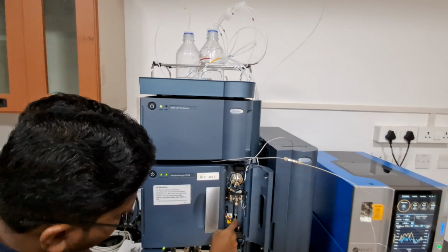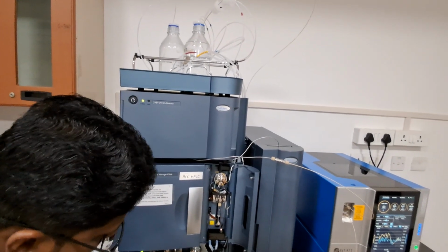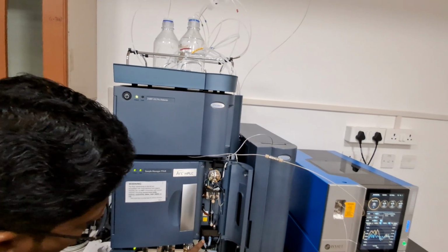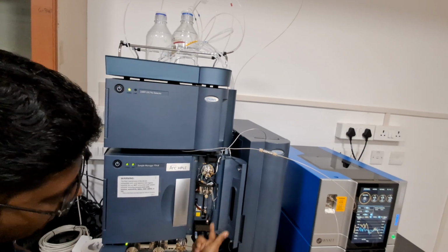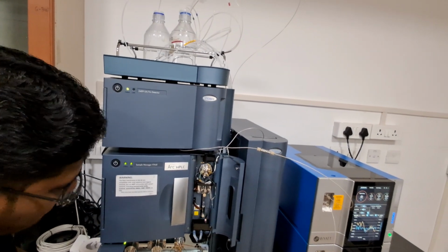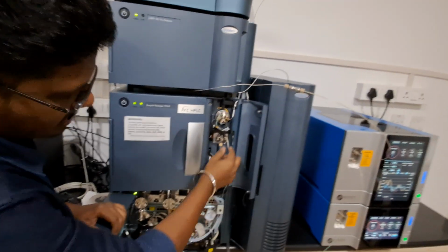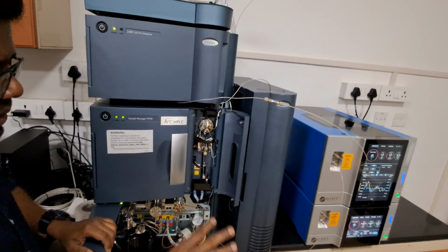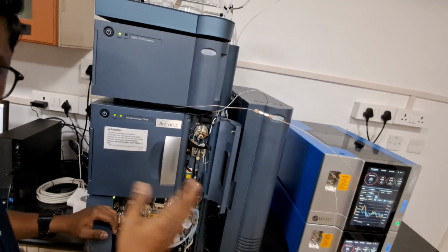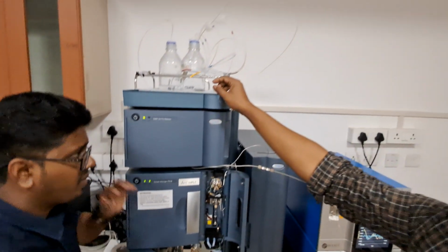That is 4 plus 1, 5, 6, and needle wash will be 7. The needle wash inlet line has been connected inside, so I cannot show you that one. Total 4 lines, A, B, C, D, seal wash line is the 5th line, 6th line, and needle wash is connected inside, the 7th line. Total 7 lines are there. 4 lines will be used for the mobile phase applications. The remaining 3 are wash lines. Am I not wrong?